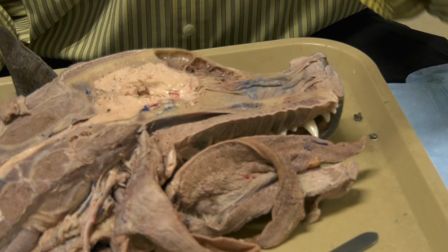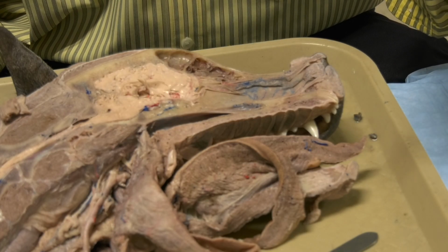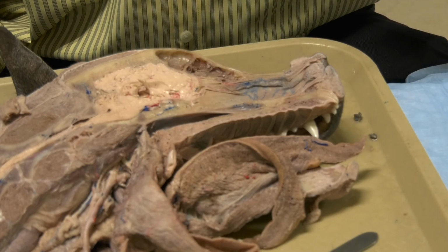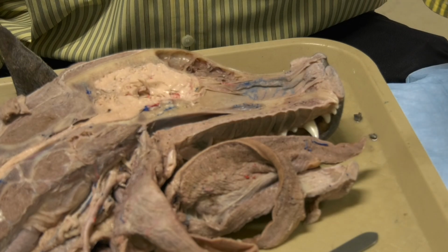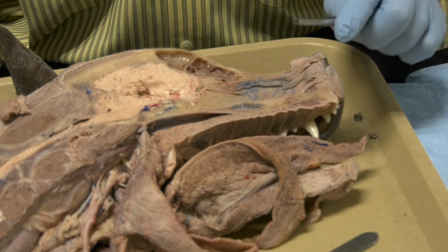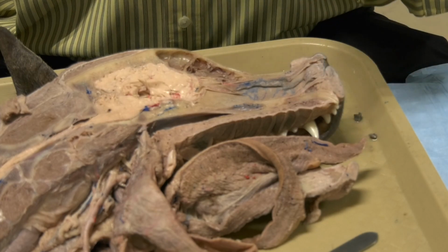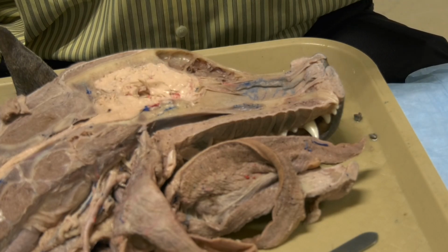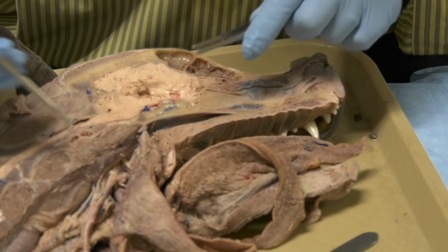All the synapses for the sympathetic nerves going to the head have to synapse at the cranial cervical ganglion. From there, the sympathetic nerve will run with the different branches of the external carotid artery, while the distal vagal ganglion is a parasympathetic ganglion for the vagus nerve.